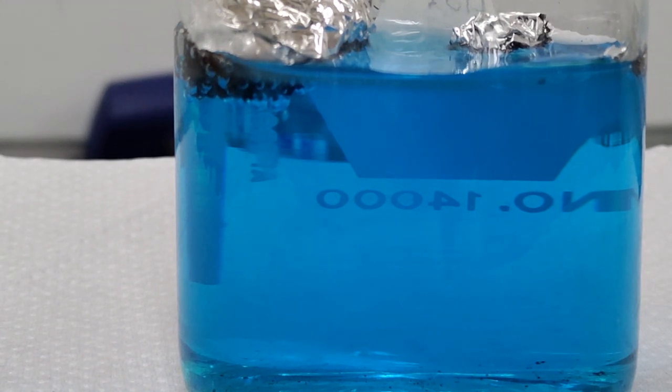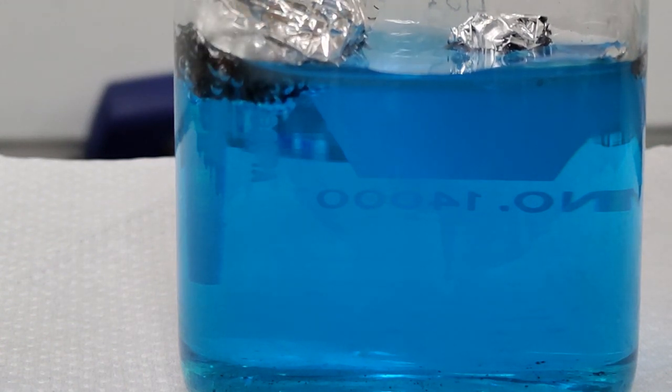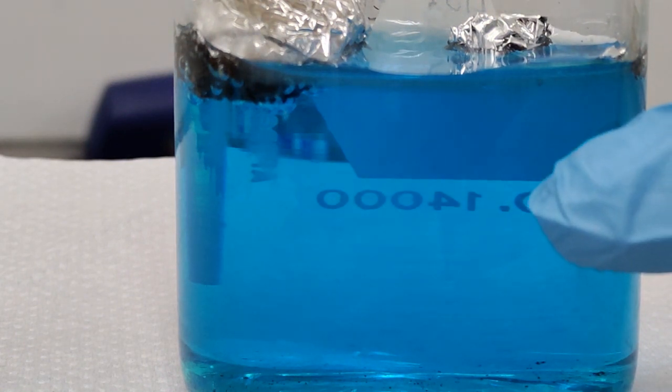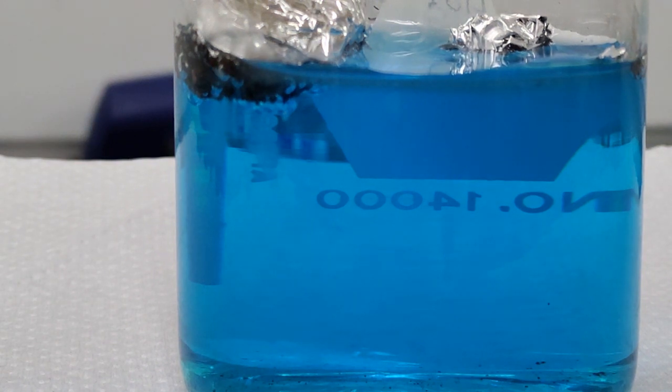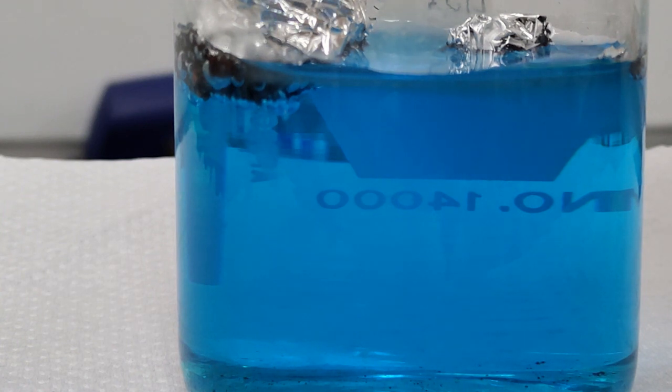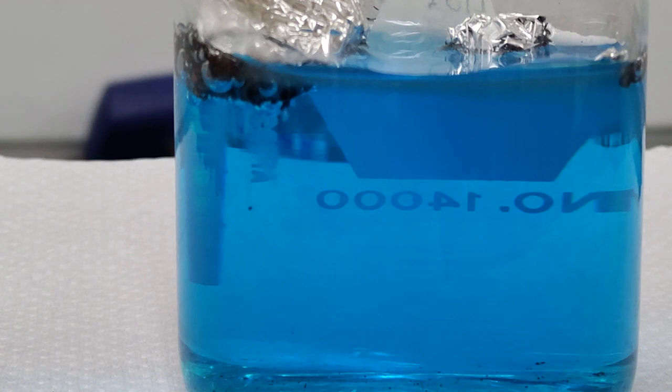All right, so it looks like the reaction has generally stopped about now, and as you can see right over here, there was originally some bits of copper falling down into the solution as the copper got kicked out of the reaction and it became aluminum chloride afterwards. But notice that it kind of stopped because there were some gas bubbles forming. This was what we would call an inhibitor to the reaction. So a couple of observations to show on that.